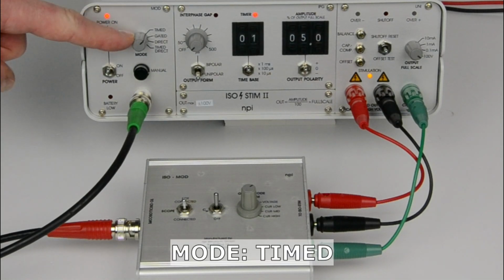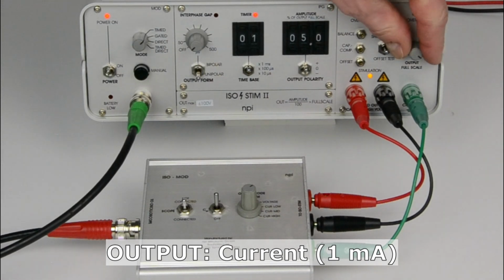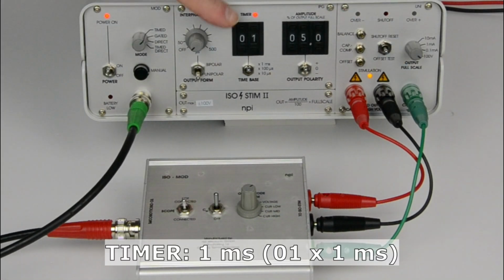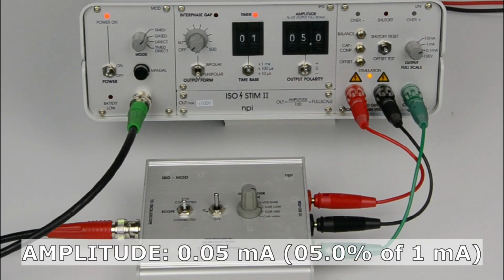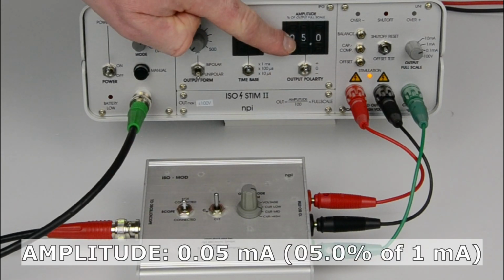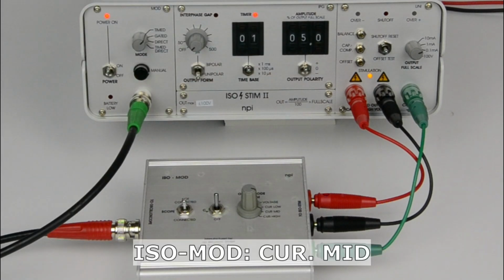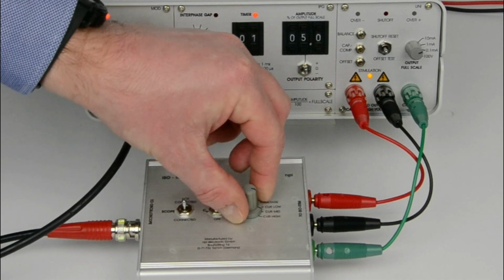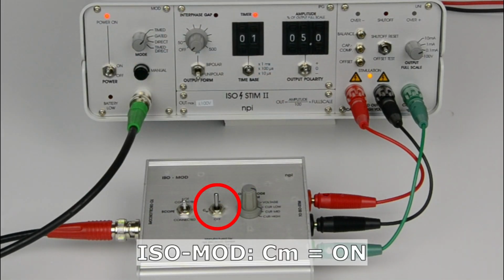We set the ISO-STIM to timed mode and the output to 1 mA. The timer should create a pulse of 1 millisecond length with 0.05 mA amplitude. We set the model cell to the middle current range and switch the membrane capacitance on.